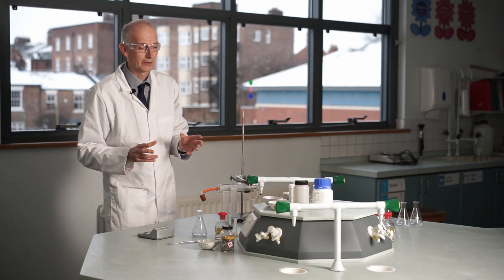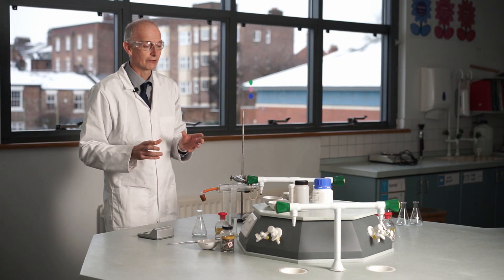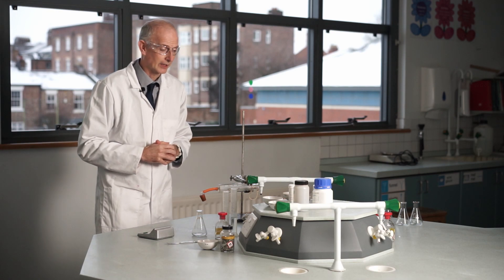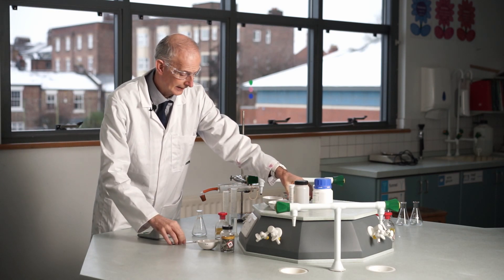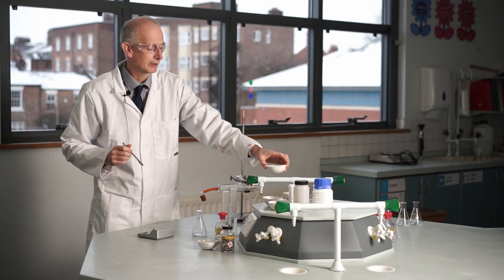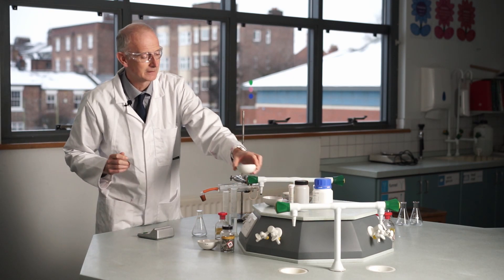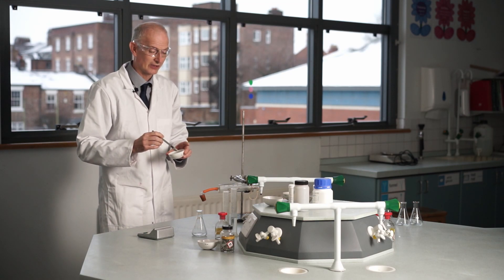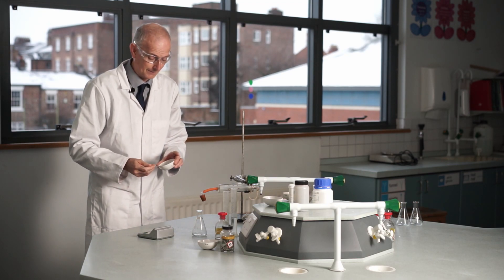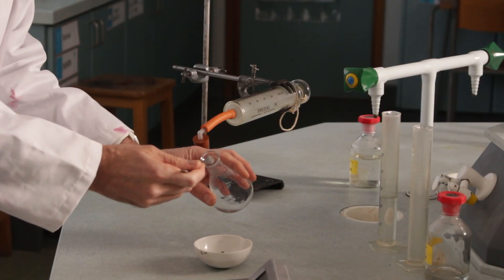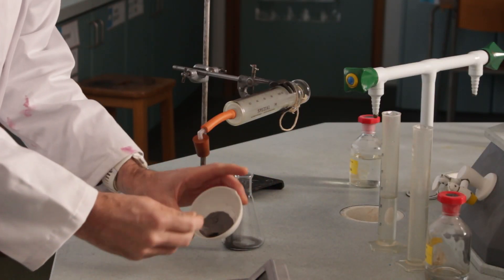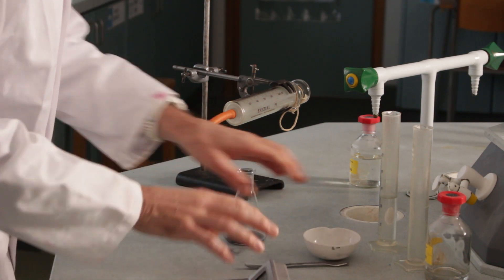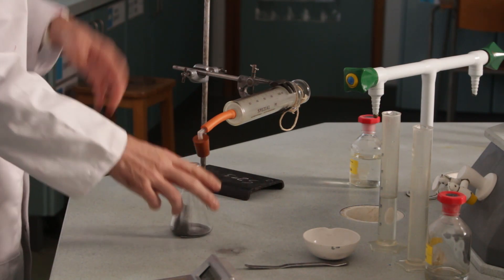So I'm going to show you a couple of these, just so you can see how it happens. And then I'll give you data for the other ones. So I thought I'd go with the zinc one first. So here's my, oh no, we'll go iron, we'll go iron. So how much of this? Well, a couple of spatulas full is all we need. And then I really need an extra pair of hands here, but I'll get by.